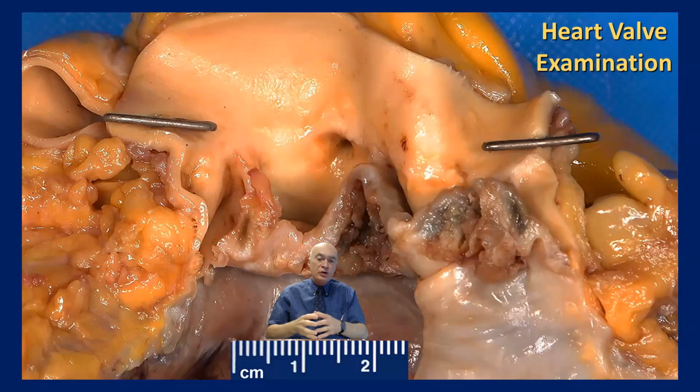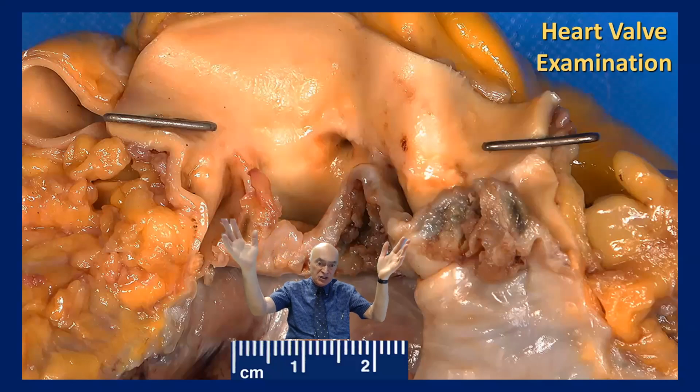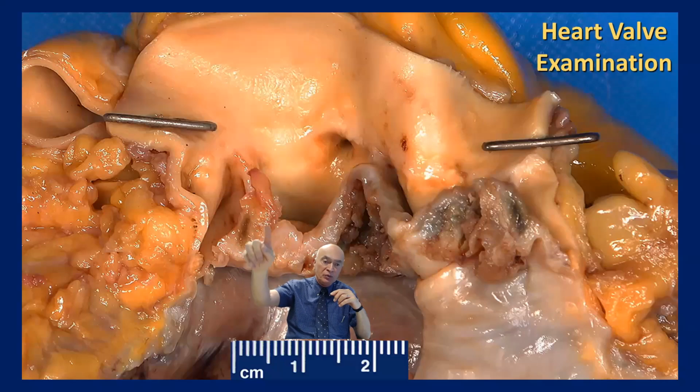And going to another part of the heart that is very important, here you have a tricuspid valve that has very severe vegetations and also fibrosis that is altering the normal flow of the blood and producing cardiac insufficiency, as you will know, depending on which valve is being affected.